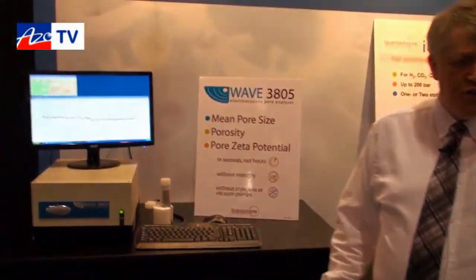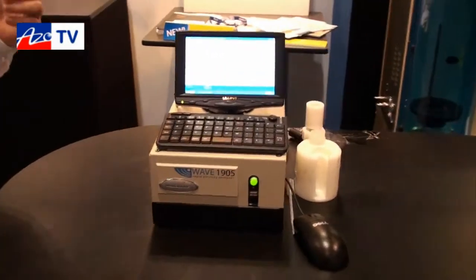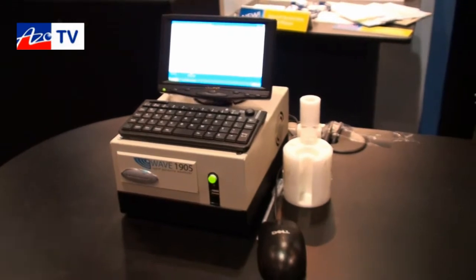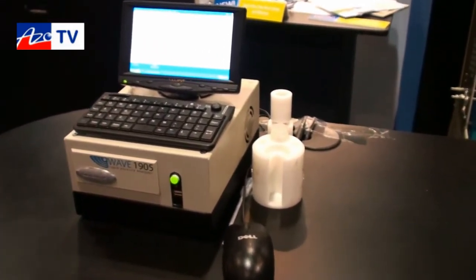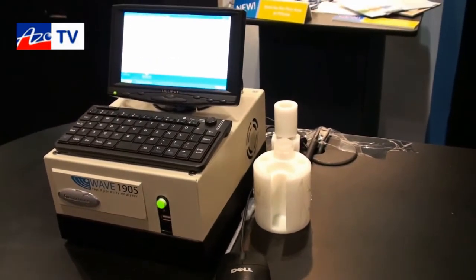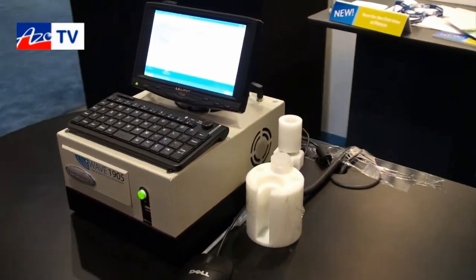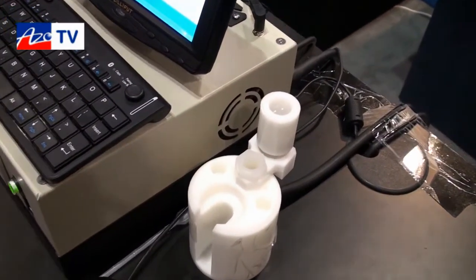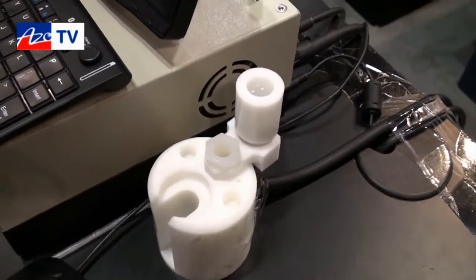Now let's move over to the smaller analyzer. The difference is that the larger unit can do those three measurements — pore size, porosity, and pore zeta potential — but many of our customers say that porosity is all they need to monitor their process. They're pressing powders, sintering powders, and just need to see how much porosity their product has.